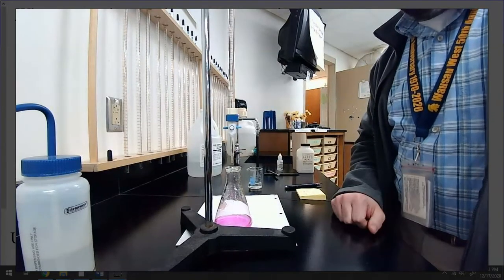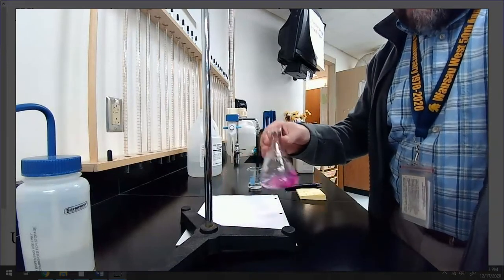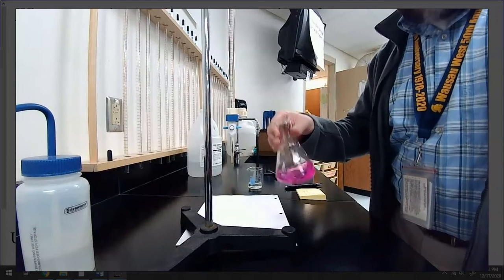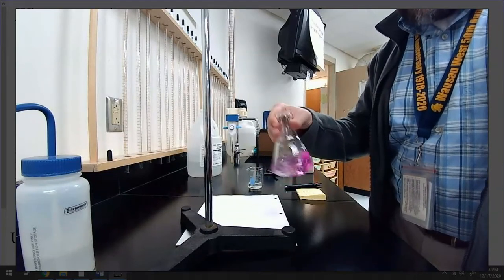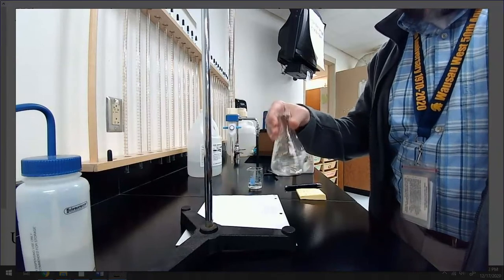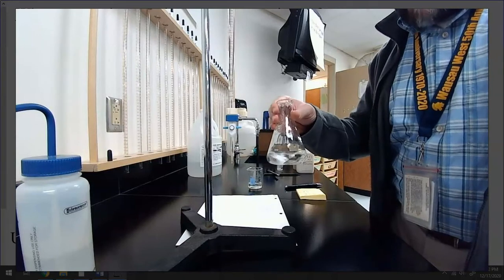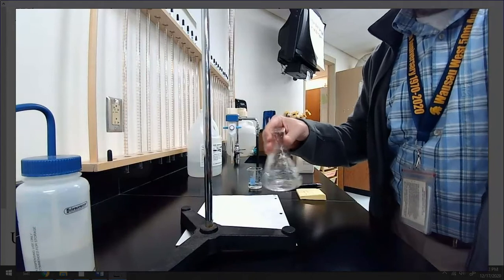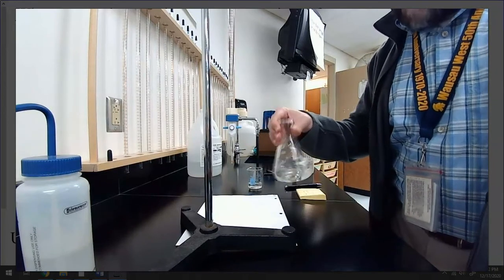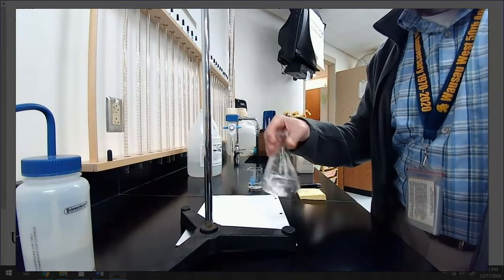Now, let's see how good of a chemist I am. You see how bright pink that is? Okay. Keep watching. I have confidence. There it goes. Okay. So it looked like it wanted to stay pink, but here was the deal. All of that solid acid wasn't fully dissolved. So that's what I was talking about earlier, right? That solid acid needs to be dissolved in order for it to be able to react with my base.